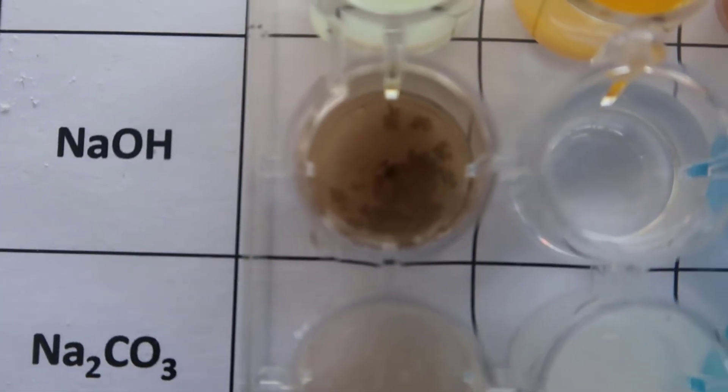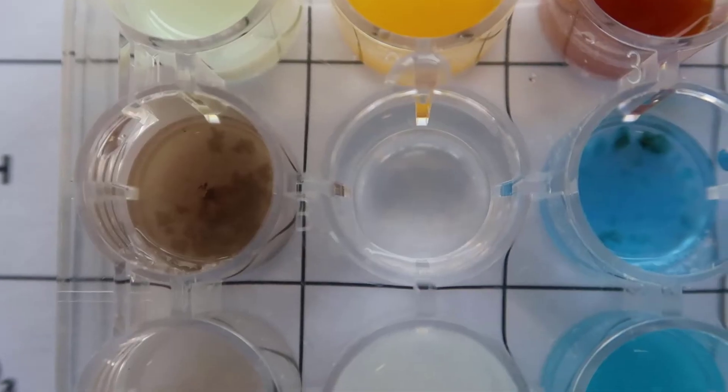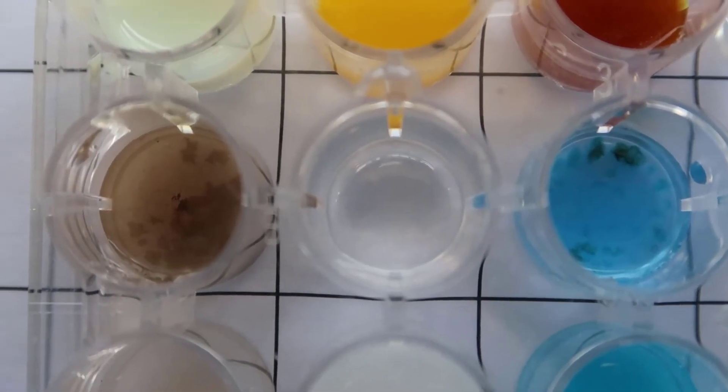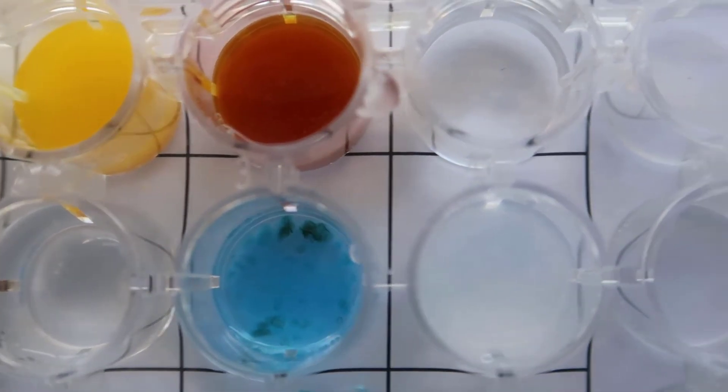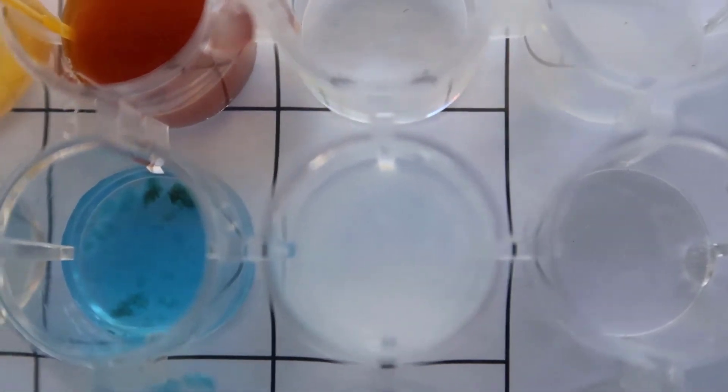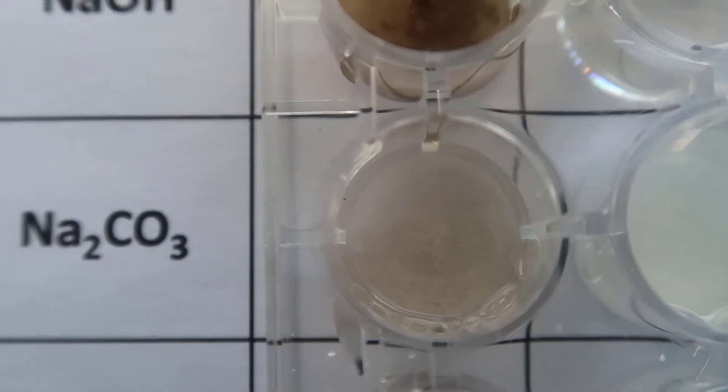Next, I'm going to do the NaOH and then this one. Again, I don't know if it's translating well but it does look a little bit cloudy.